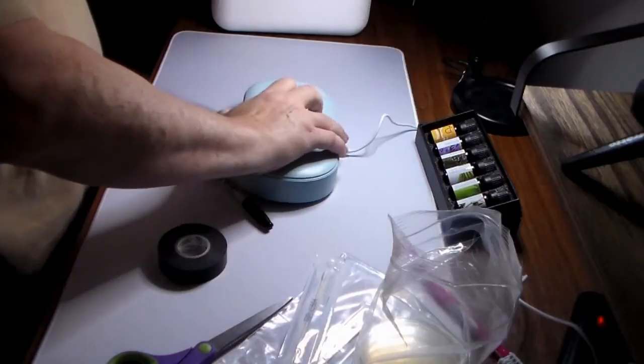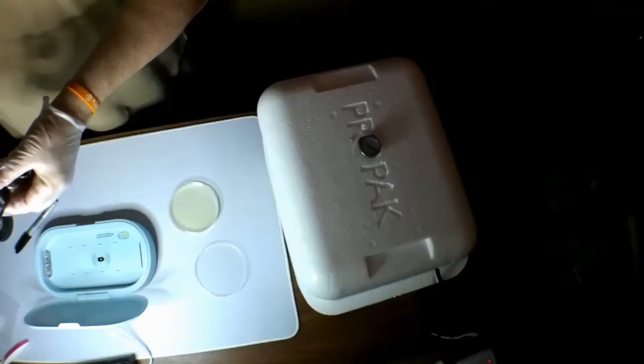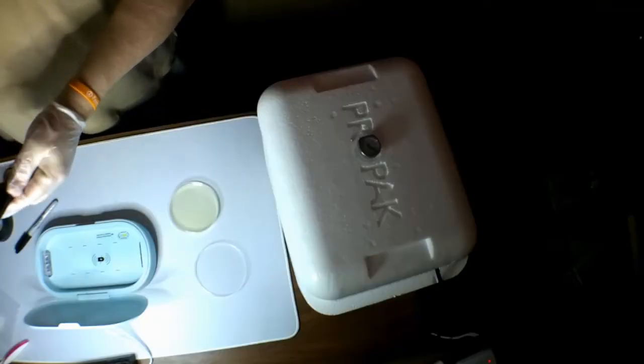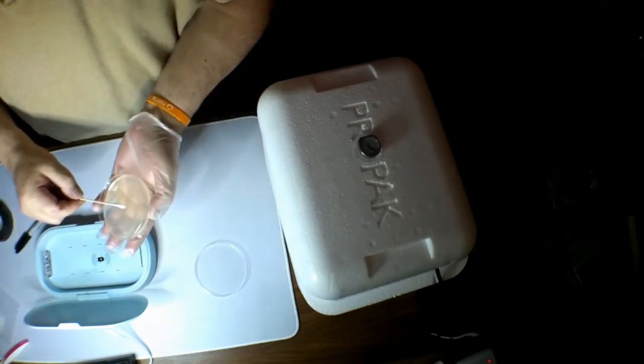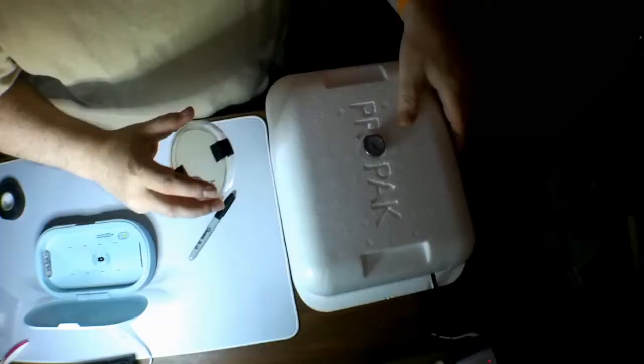Be right back. Alright, the keys are done. Let's get them out. So we are wearing gloves this time because we will be handling it. Got our moistened sterile swab, and we go. Alright, we've come to our surprise of the evening, the coup de grace, and I'll share that with you shortly. Be right back. Are you ready for this? Here we go. The last item of the day.